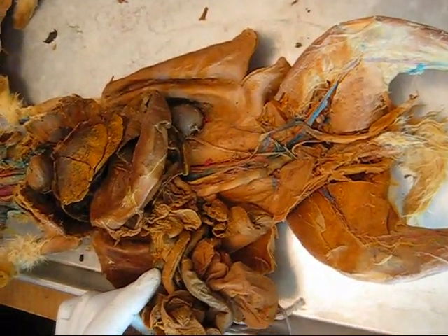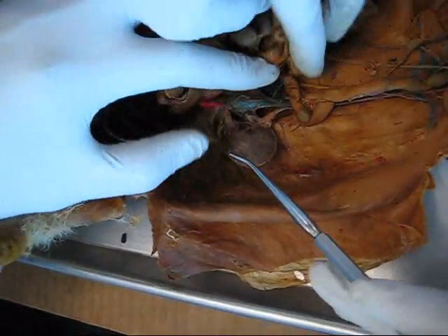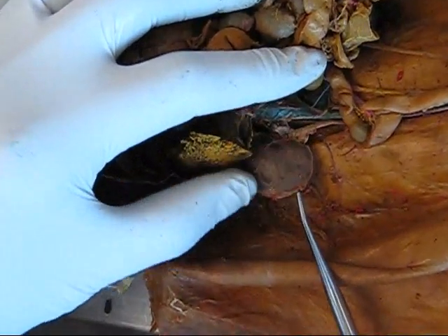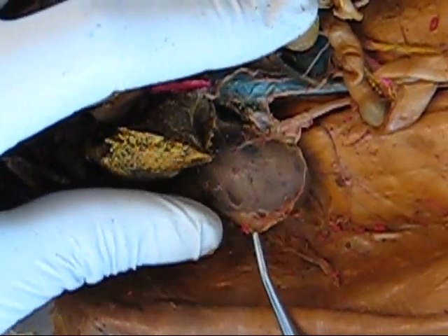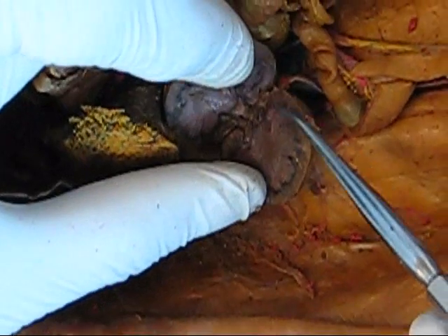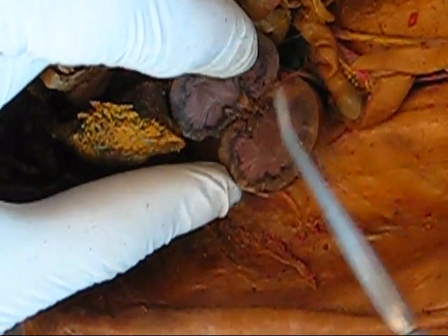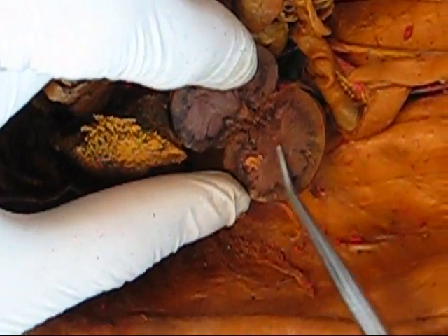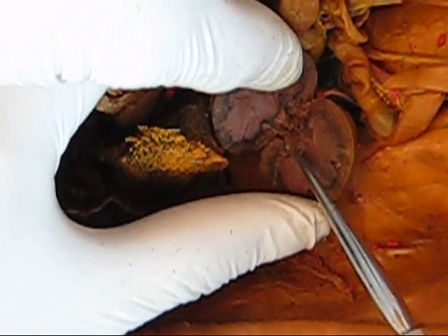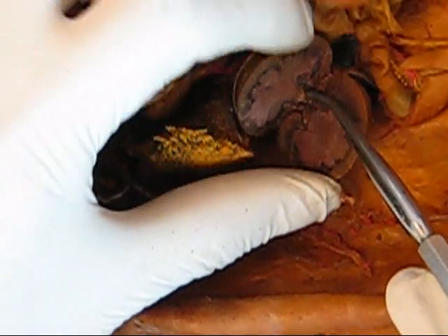Going on to the urinary system. Kidney — we have the kidney here. Renal capsule — it's this membranous sheath over the kidney. Renal cortex. Renal medulla. Renal pelvis — this is the renal pelvis here. Renal hilum — it's the opening where the vessels enter and exit.